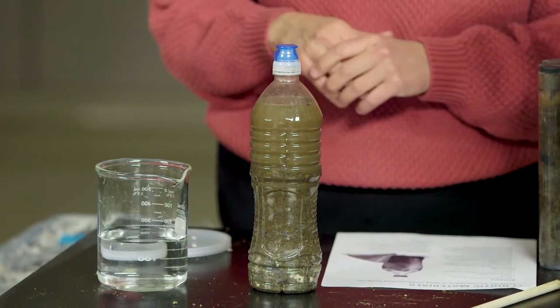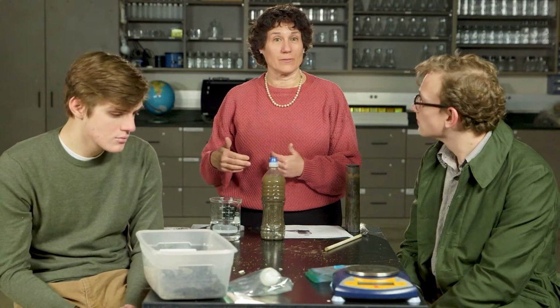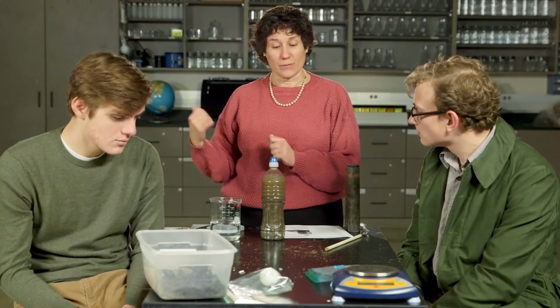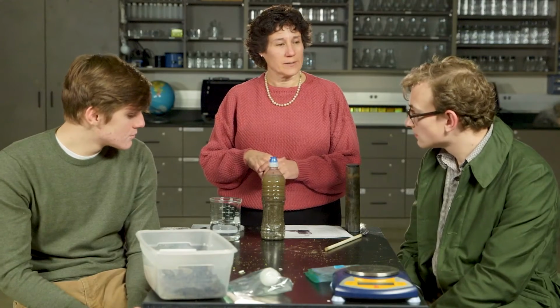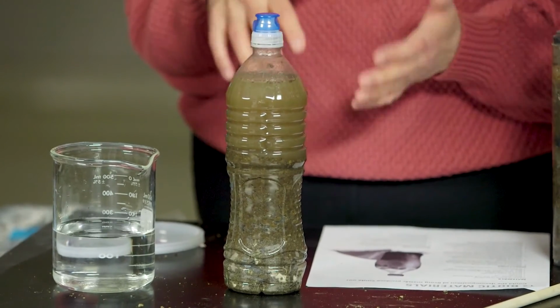The gas will build up inside the bottle. When you want to let it out, you probably want to do it outside because it might actually have a smell to it. You've got the sulfate in there, so if you take it outside and actually burp it, so to speak. So as you have your students look at it, then think about these types of questions. Ask them what is happening inside the bottle, what types of bacteria are active in the environment, are there changes based on that bacterial activity? Are soil and water just lifeless parts of the ecosystem, or what are they adding to that ecosystem?